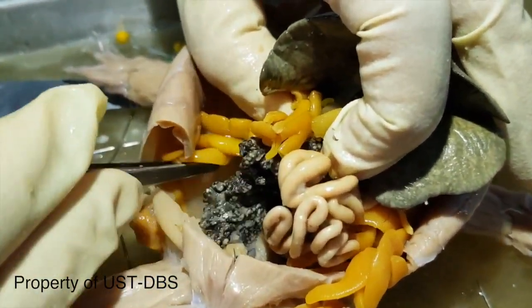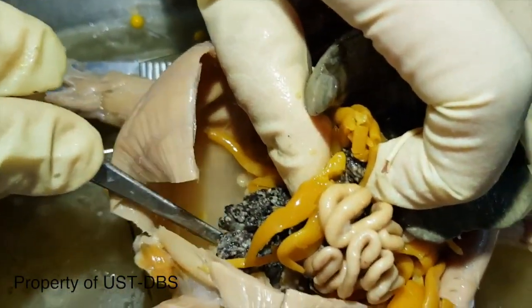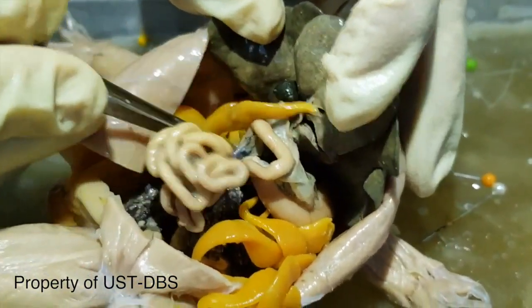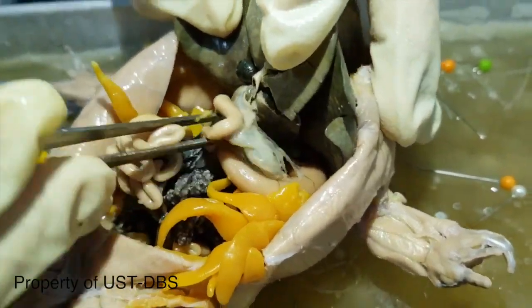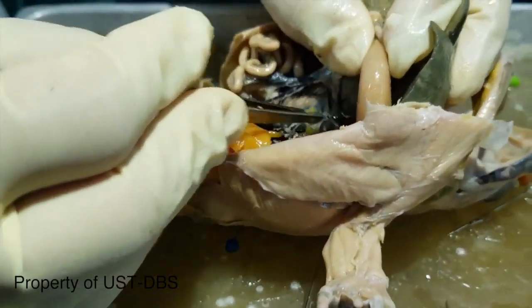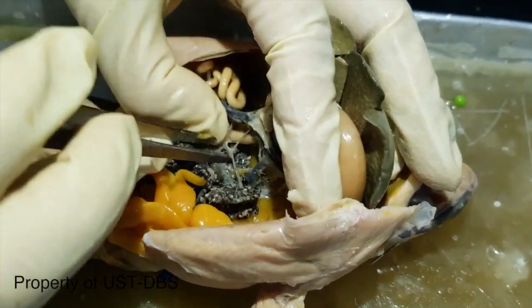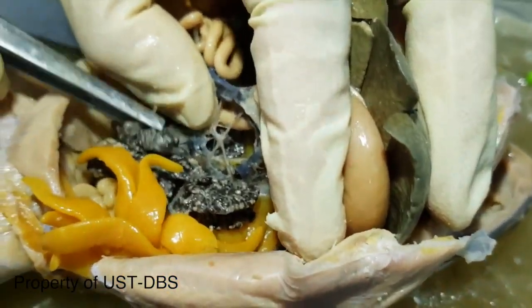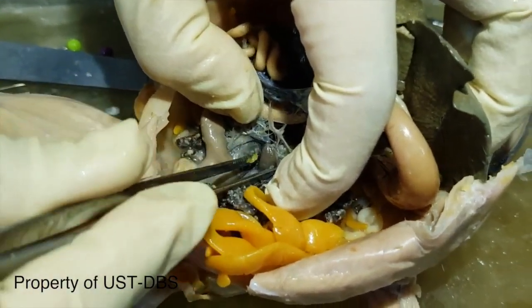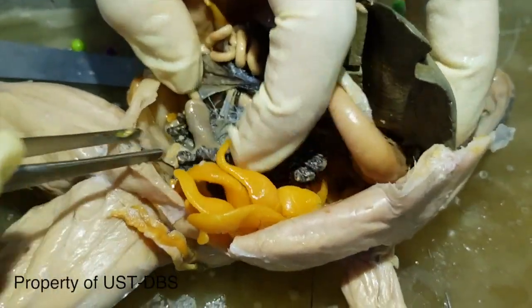From the ovary, the eggs travel to this coiled structure, the oviduct. These are fat bodies. This structure here, this one is the spleen. This black-brownish structure is the spleen. Okay, that's it.